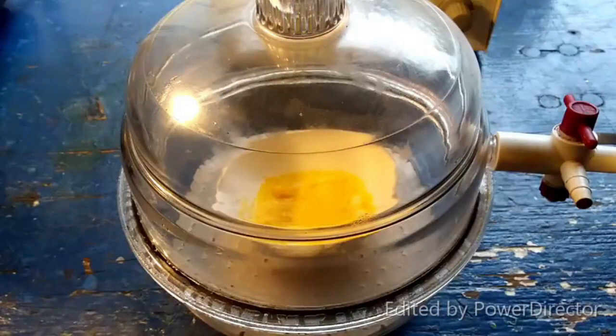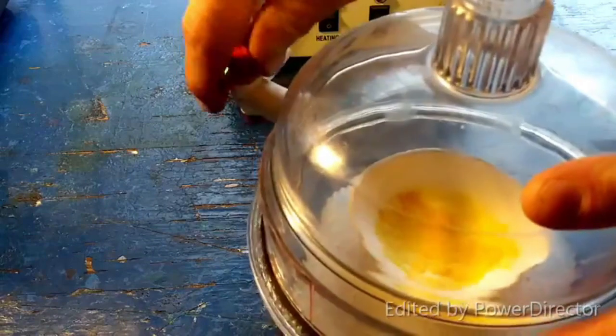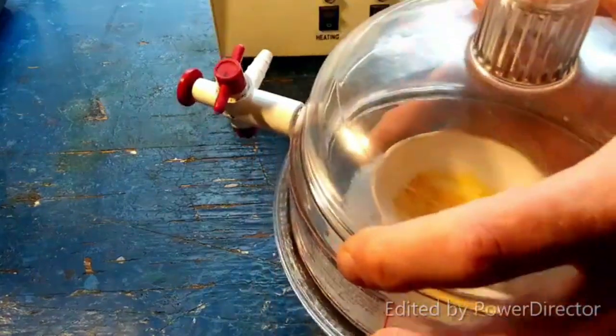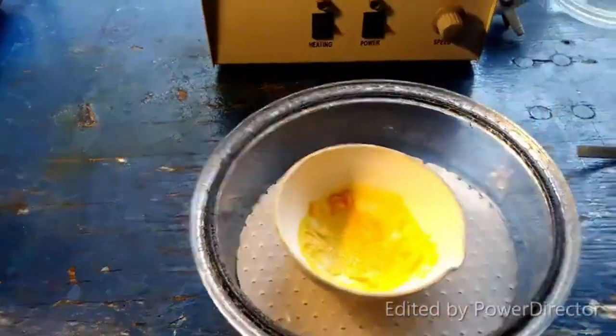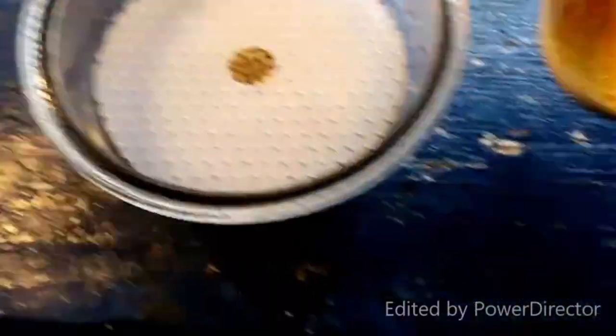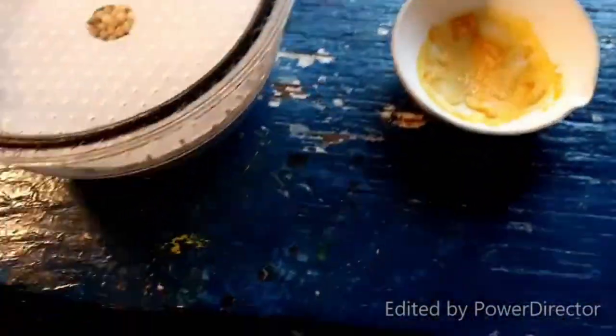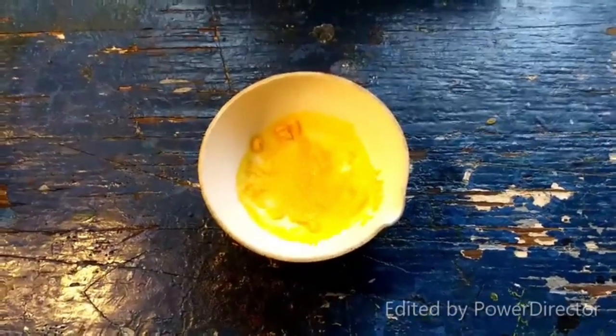Alright, everybody, it is the next day, and this stuff has been drying out overnight. Let's take a look. Looks pretty damn nice from what I've seen thus far. Oh yeah, look at that. That is gorgeous. Well, probably should take it out of the desiccator here. Been raining all night, and I'll just leave it open with the desiccant, right? Yeah, no problem. Okay, anyway, there we go, people.